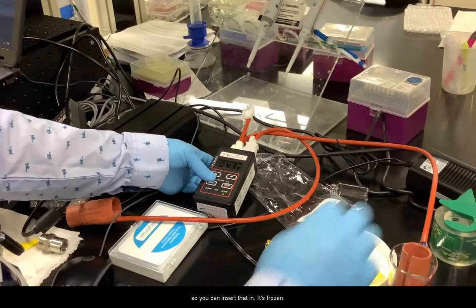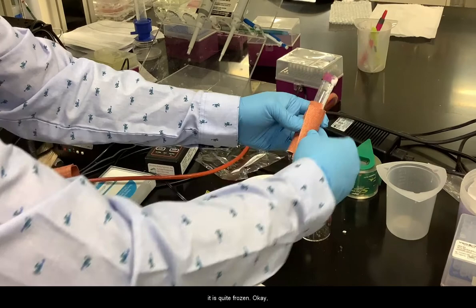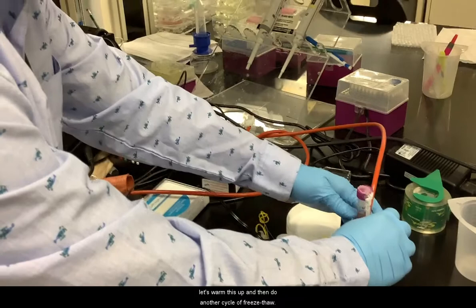You can insert that in. It's frozen, right? Oh yeah, it's quite frozen. I was checking to make sure it didn't crack. Okay, let's warm this up and then do another cycle of freeze-thaw.